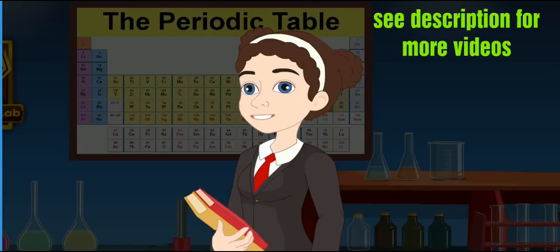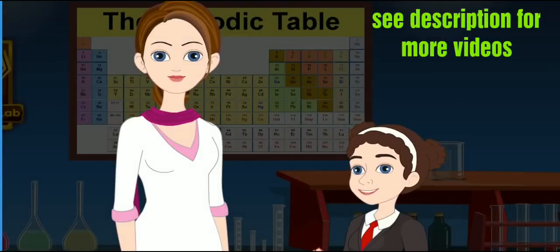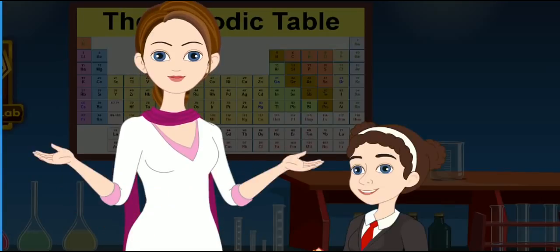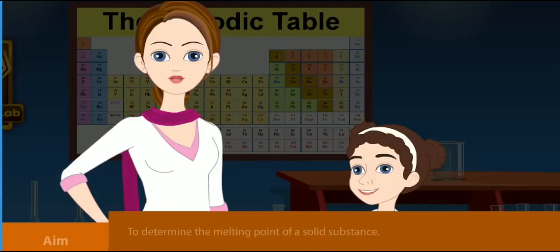How can we determine the melting point? Let us do an experiment to determine the melting point so that you can understand it easily. Aim: To determine the melting point of a solid substance.